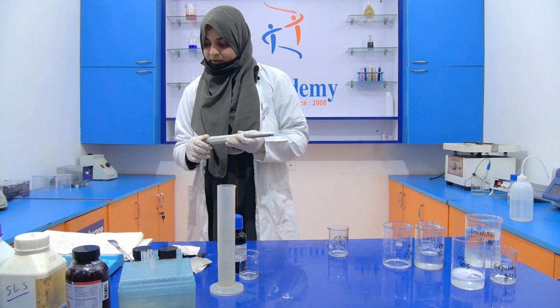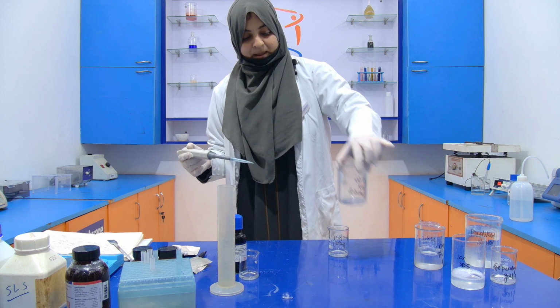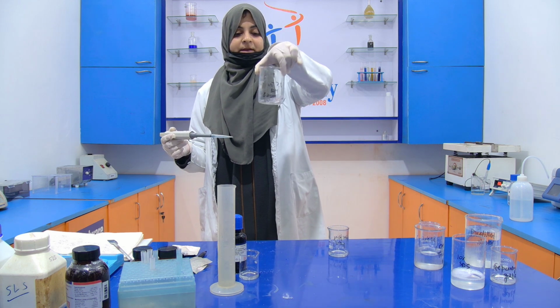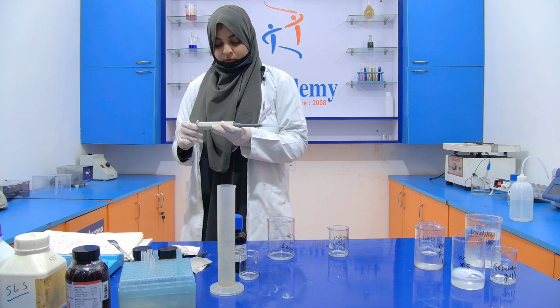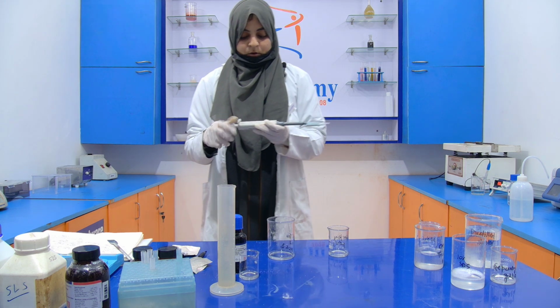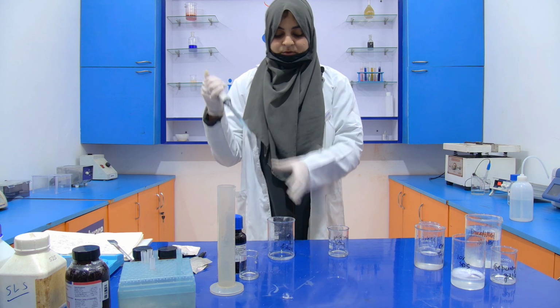Then after that, we are going to add 2.6 ml of 0.5 molar Tris HCl. So first of all, you have to add 2000 microliter.